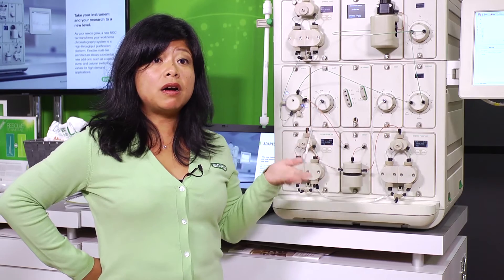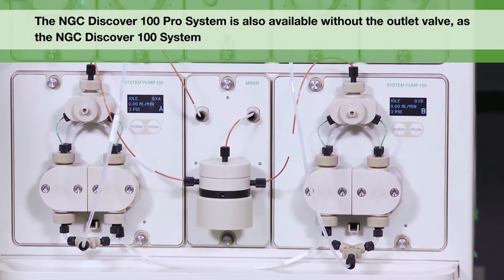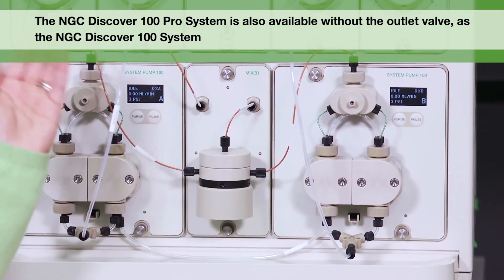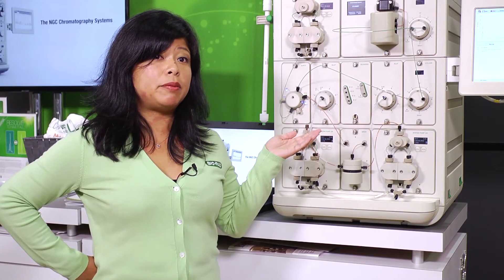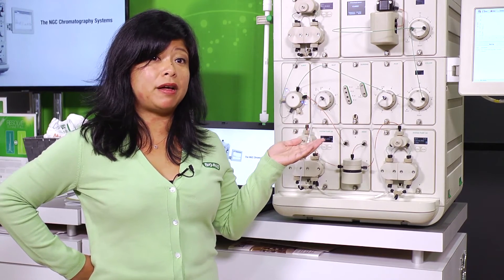With the Discover Pro, you also have two column switching valves. Columns can be screened using the column switching valves — up to five different columns can be put in line at any time for each valve. So we can get up to 15 different columns onto the NGC system when you add three different column switching valves.